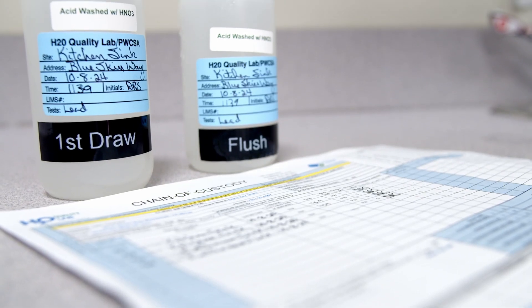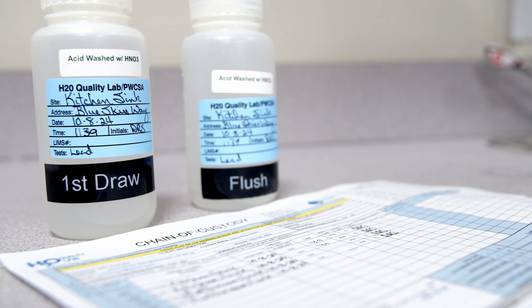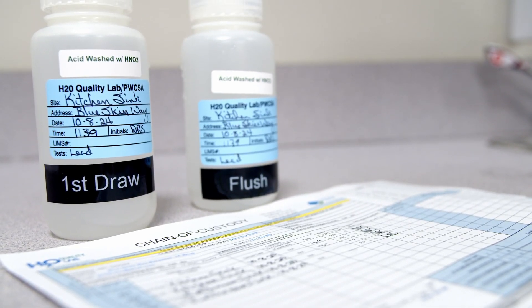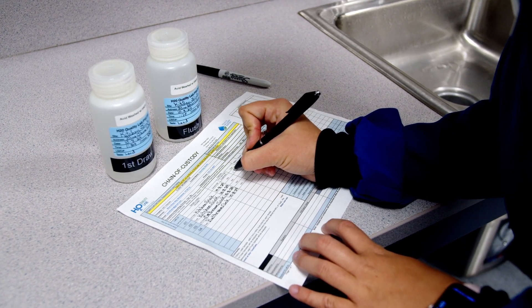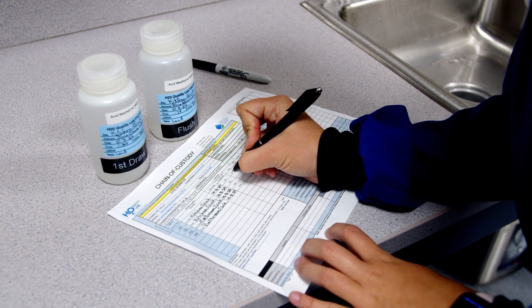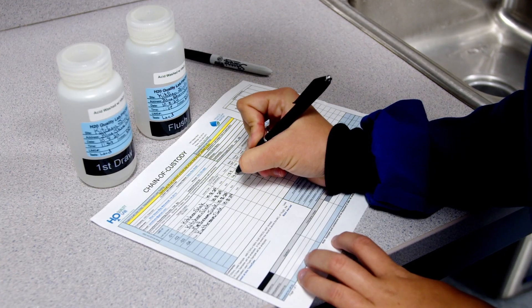If you have 12 sinks and only one came back with an elevated lead level, you must know which sink that is. Make sure whatever means of identification you use is clearly written on the bottle with permanent marker and written the same way on the chain of custody. Please use ink that will not smear or run if it becomes wet.